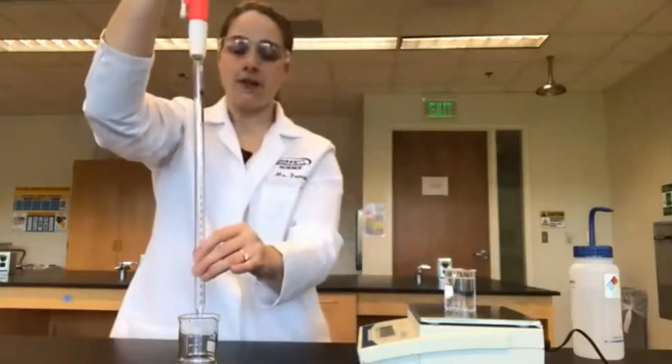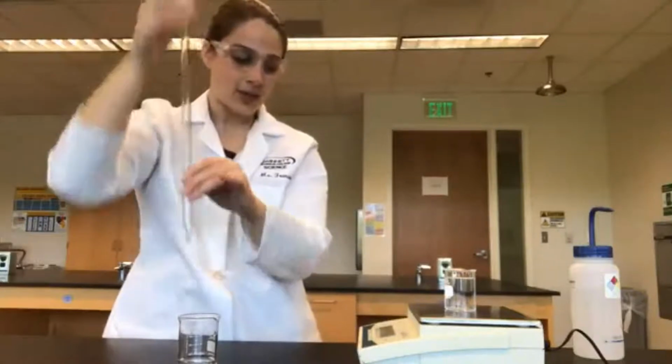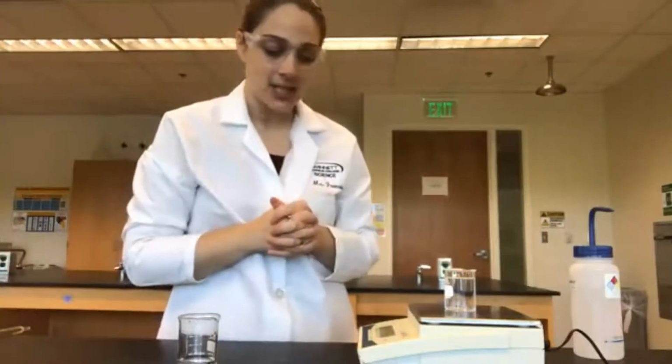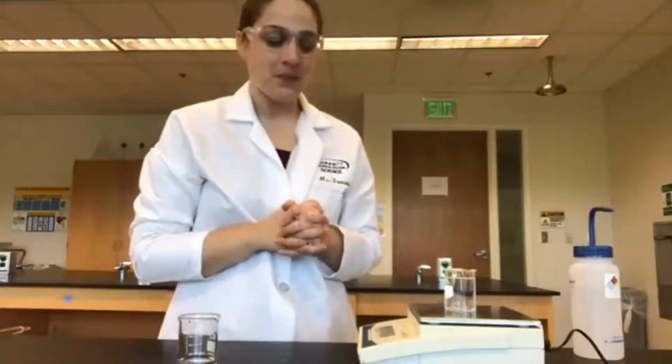Okay, and our final mass after 50 milliliters is 77.77 grams.